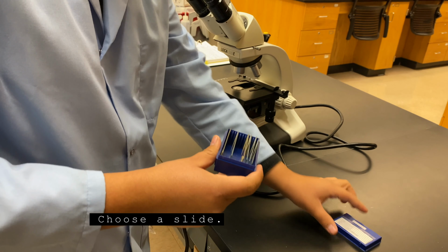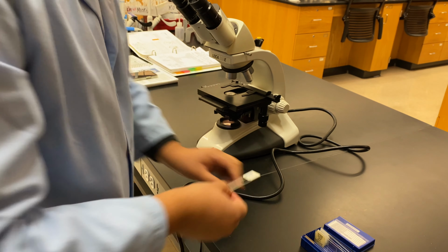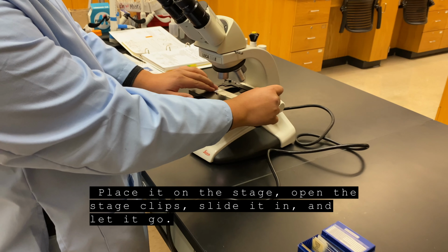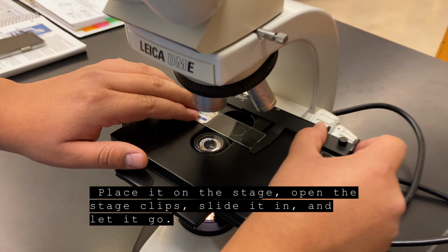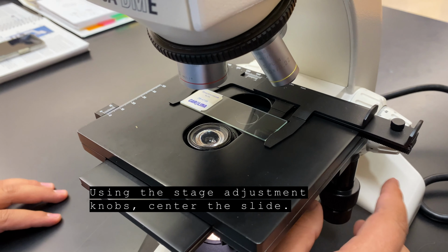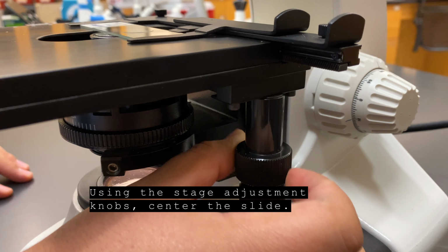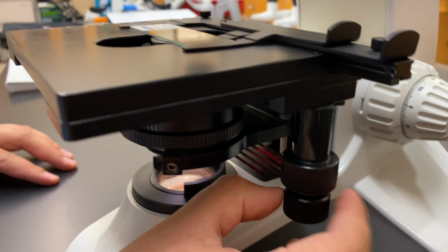Choose a slide. Place it on the stage. Open the stage clips, slide it in, and let it go. Using the stage adjustment knobs, center the slide.